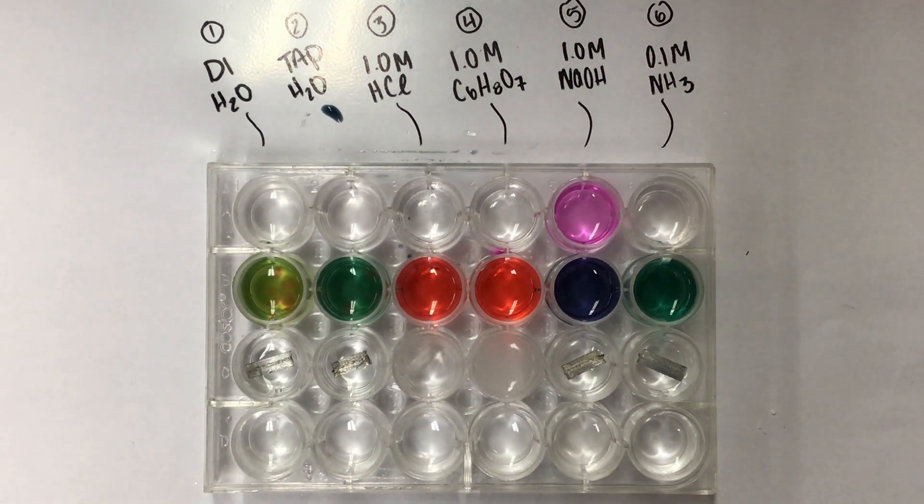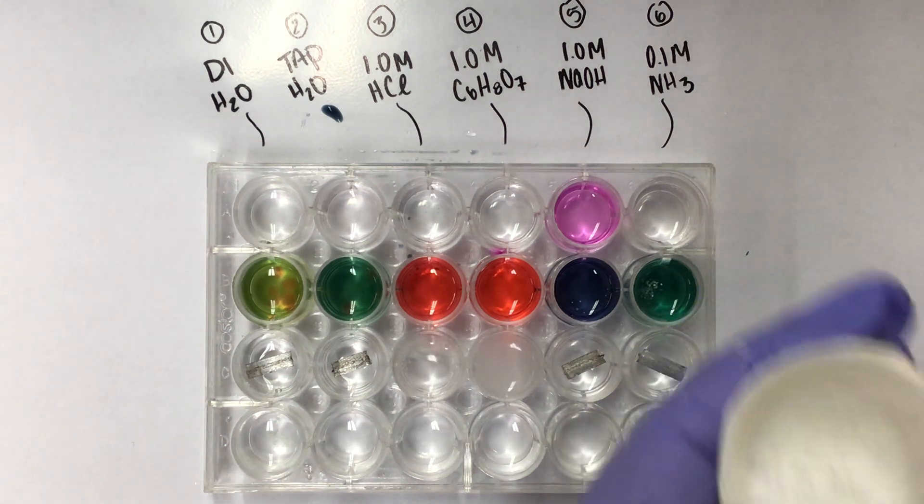Now I'm going to move on to the last test, which is our reactivity with calcium carbonate. Here's the calcium carbonate, white powder. I'm just going to take one very small scoop.